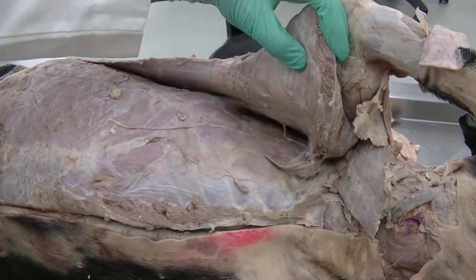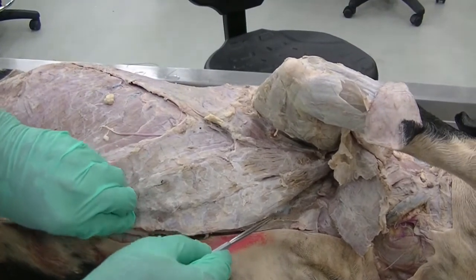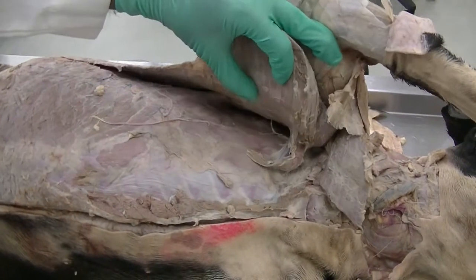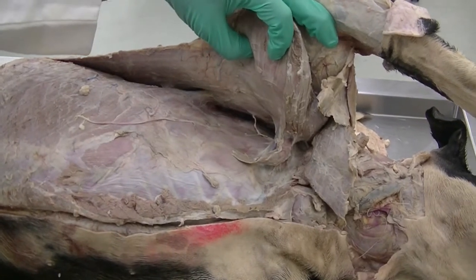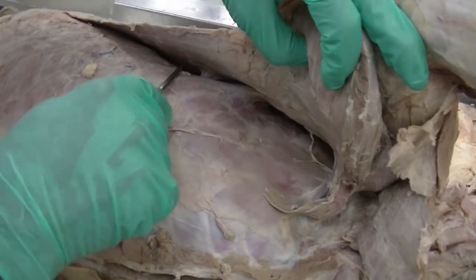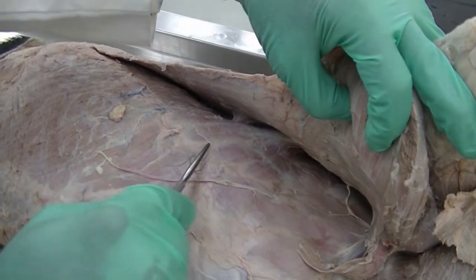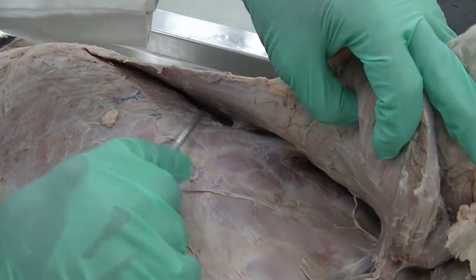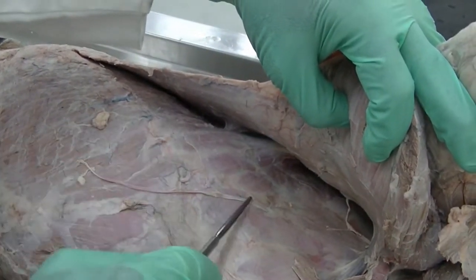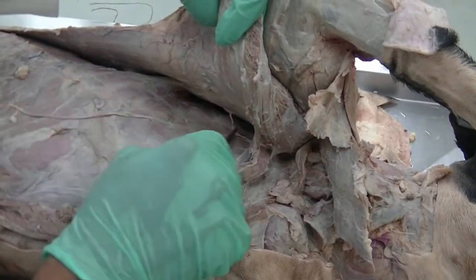Now we are looking at the forelimb after transecting the deep pectoral muscle as well as superficial pectoral muscles. We try to push the forelimb away from the trunk, and we see another extrinsic muscle, which is the largest one, has its serrated edge which connects scapula from its medial aspect to the rib cage as well as to the neck. And so this is your serratus ventralis muscle.